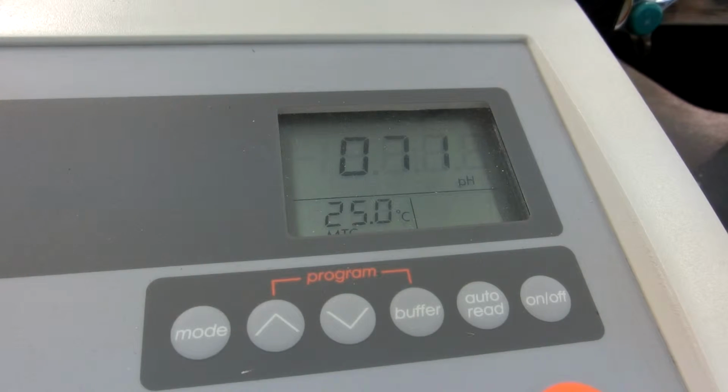Alright, we're going to be doing 0.1 molar HCl from a 10 milliliter pipette for a second trial. But this time, I'm going to make the increments of the volume vastly different than we did before.